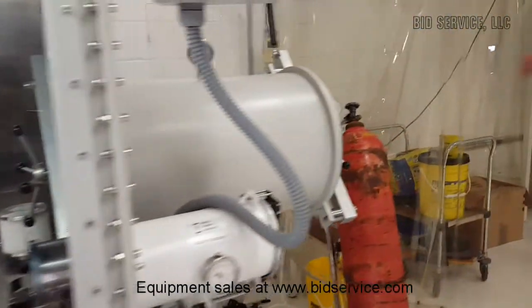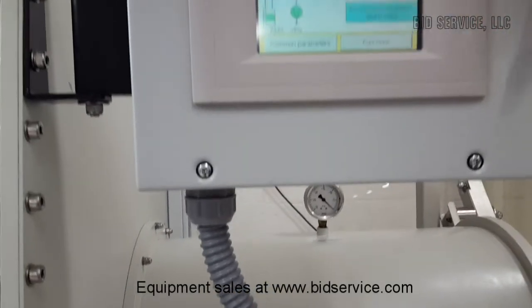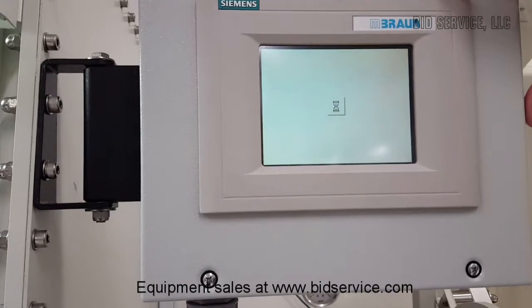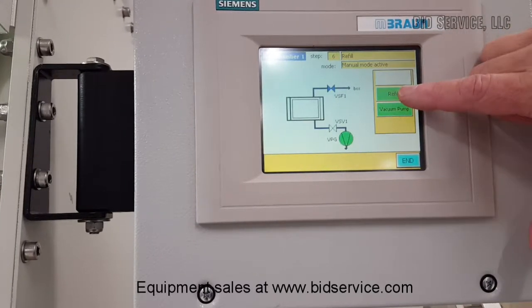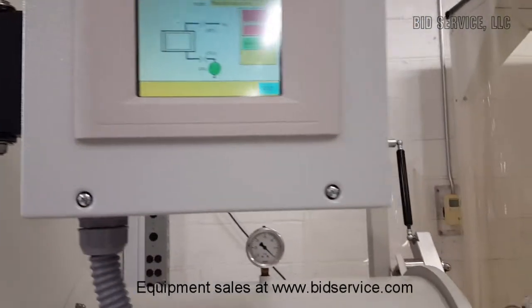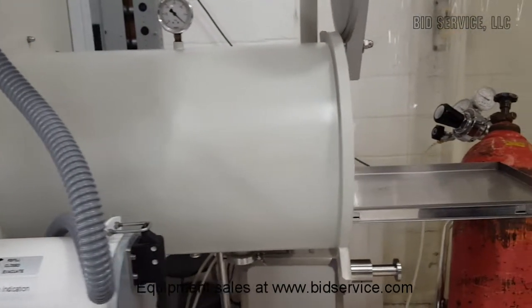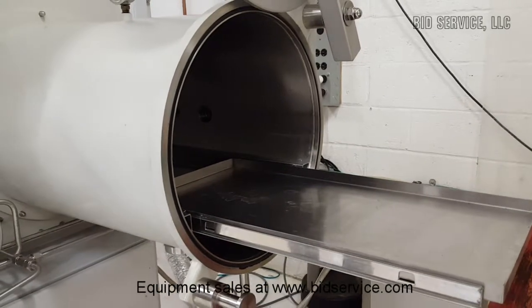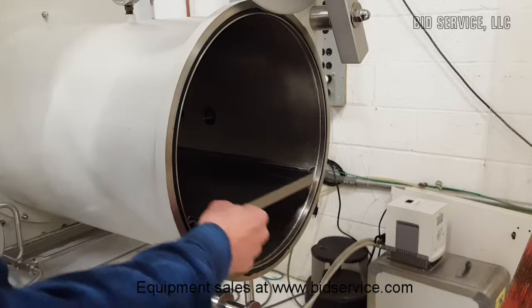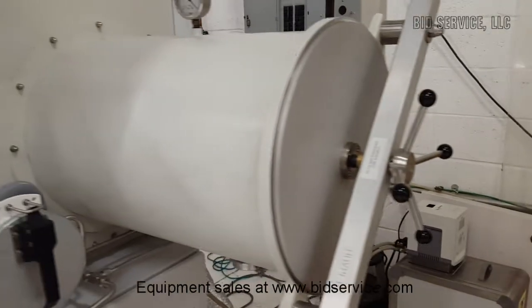Let's look at the large antechamber now. We're at atmospheric pressure, as you can see by the gauge. I'm going to close the refill valve, hit end, and then we'll open our door. You do have a sliding shelf that you can place your work on. Close it up and you're back on the screen here. This is all manual.